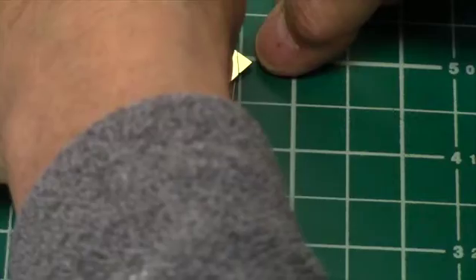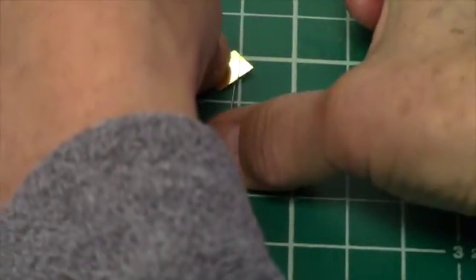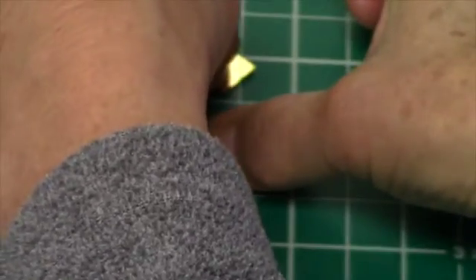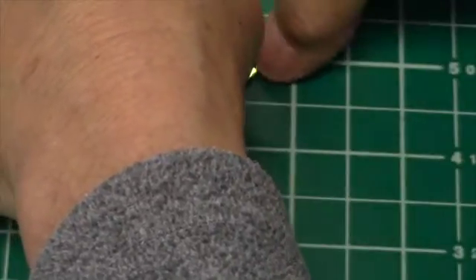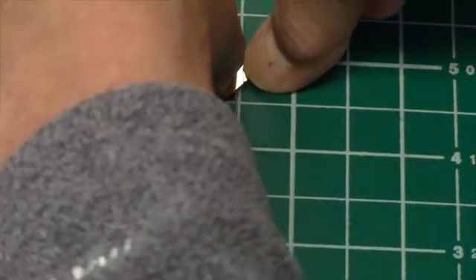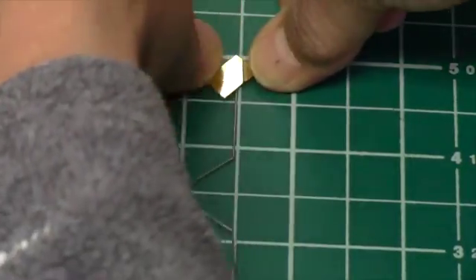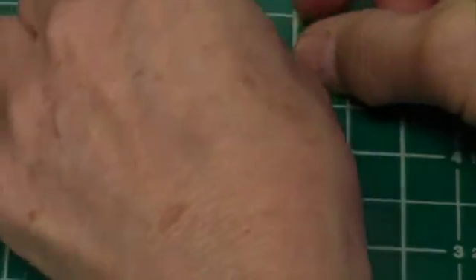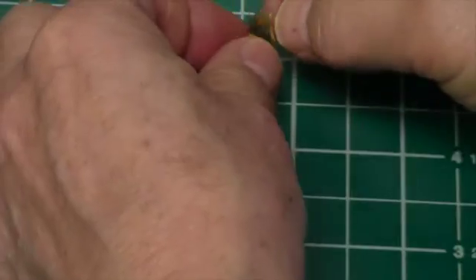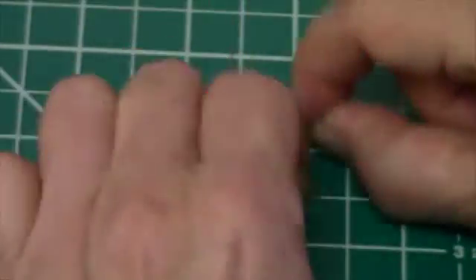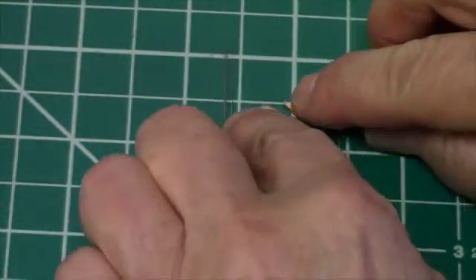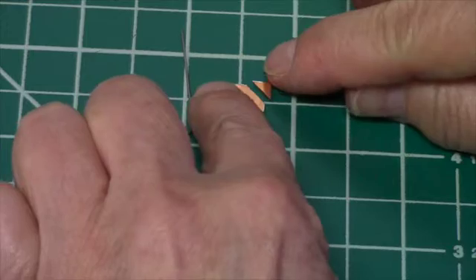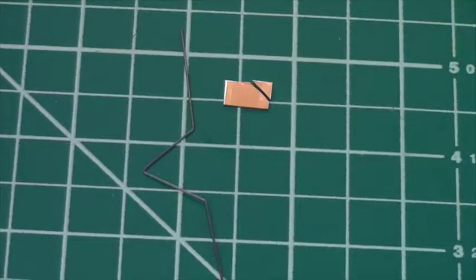I just lay the sample so that it's straddling the pin, and now I'm going to push on either side. There's my sample, and here's the cleaved sample.